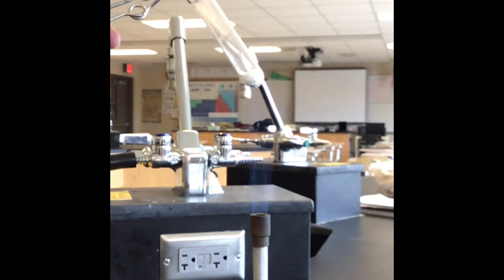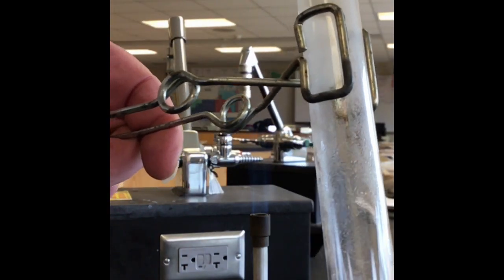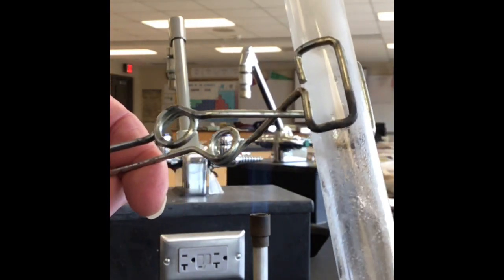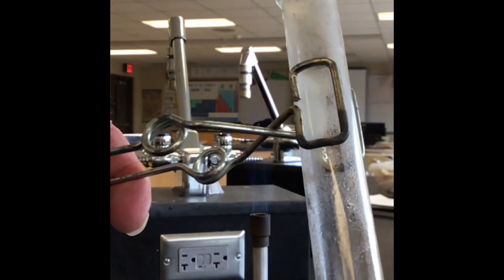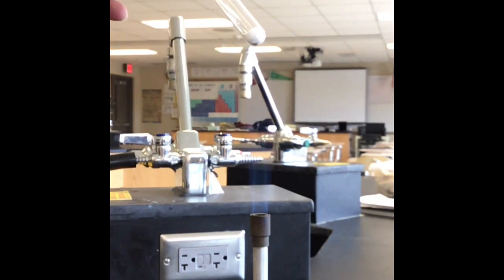And now let's take a quick look at this test tube. Look at that test tube. It's kind of foggy inside. That's condensation. So it looks like a kind of transparent liquid of some sort. The most obvious choice for a product then would be water. Transparent liquid, most common one is water. So we'll decompose it a little bit, noting that water will be one of our products. And so now it's decomposed for a little bit.